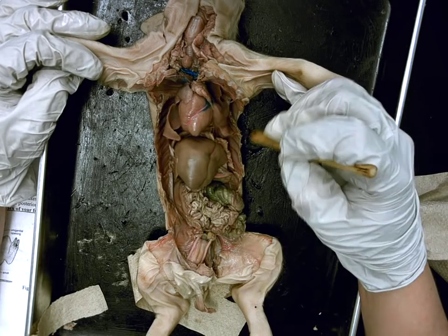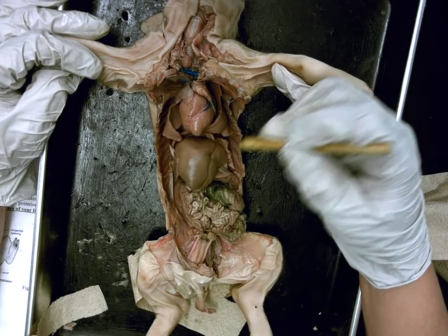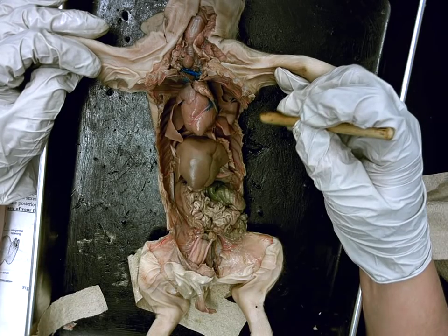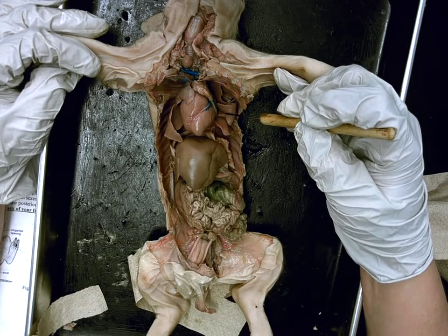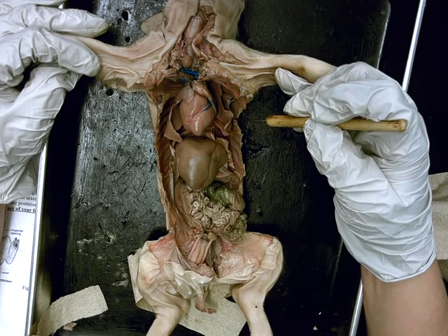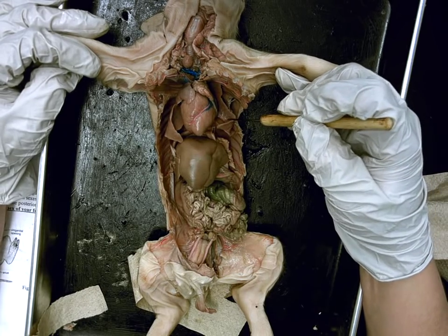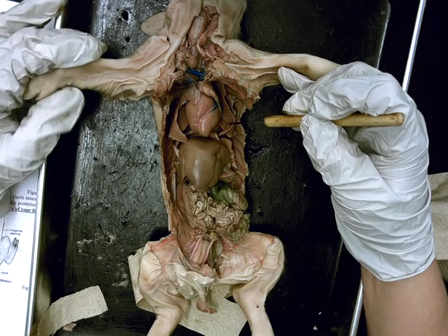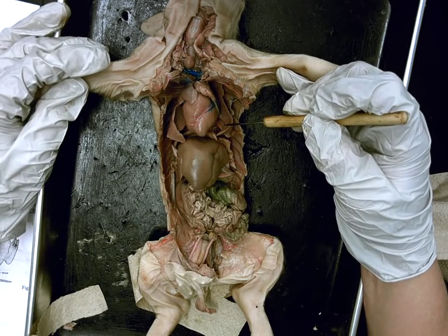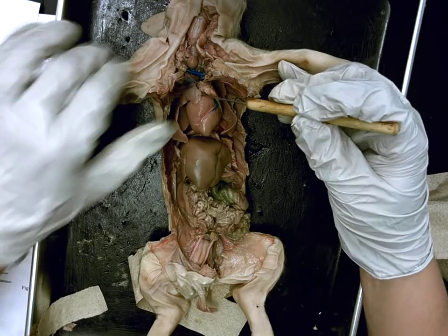Wrapped around the heart are these little soft frilly structures — there's a bunch of different lobes. Marilla? The lungs. Function of the lungs? Take in air, and what are they going to bring into the blood? And what are they going to get rid of from the blood? CO2. Excellent. So they bring in O2 and remove CO2.